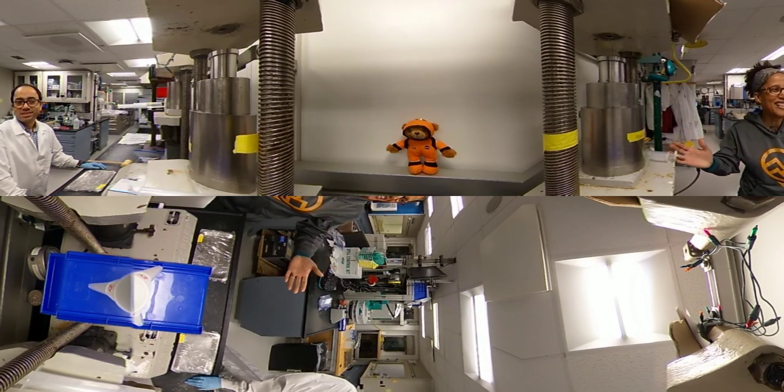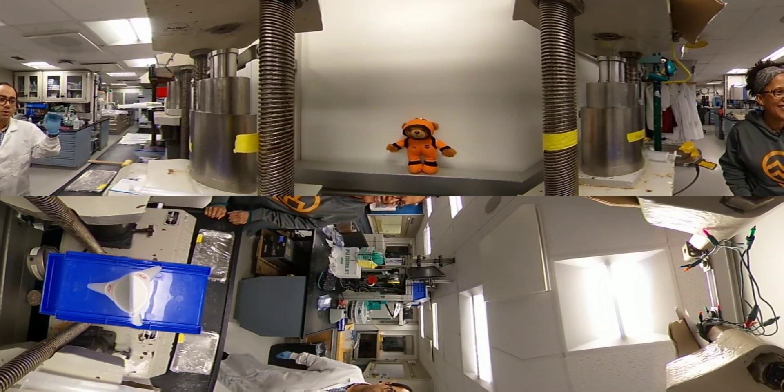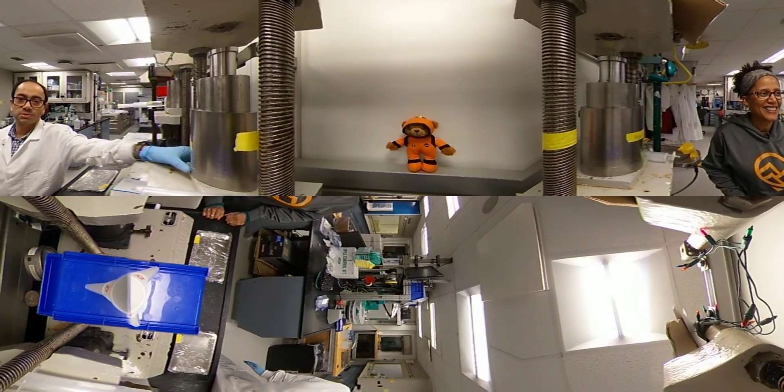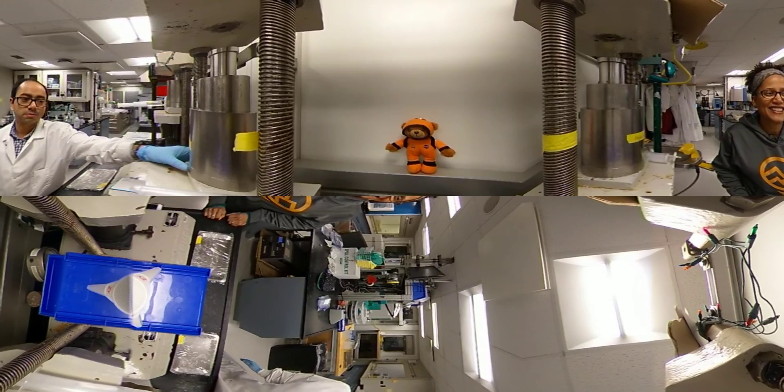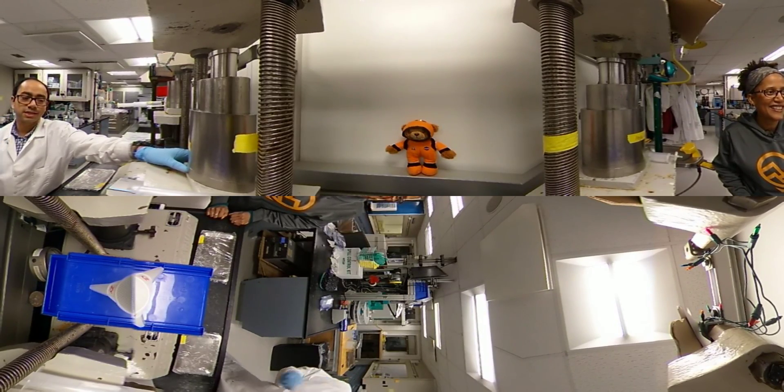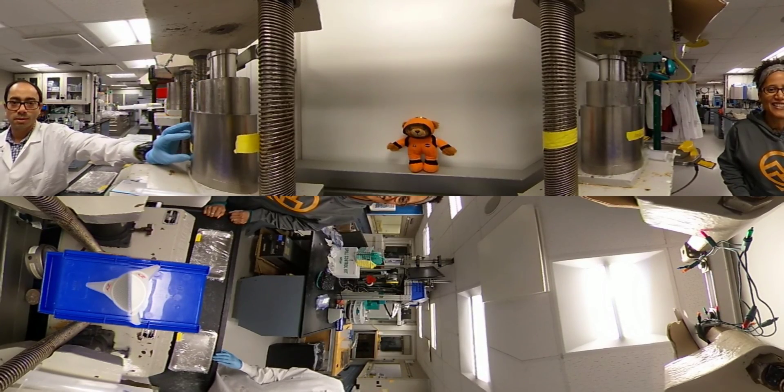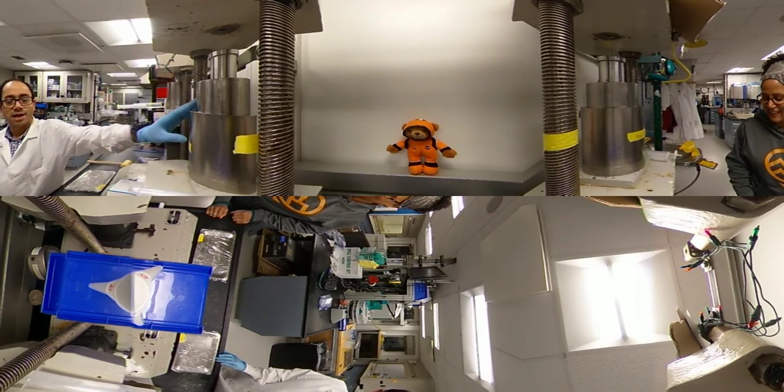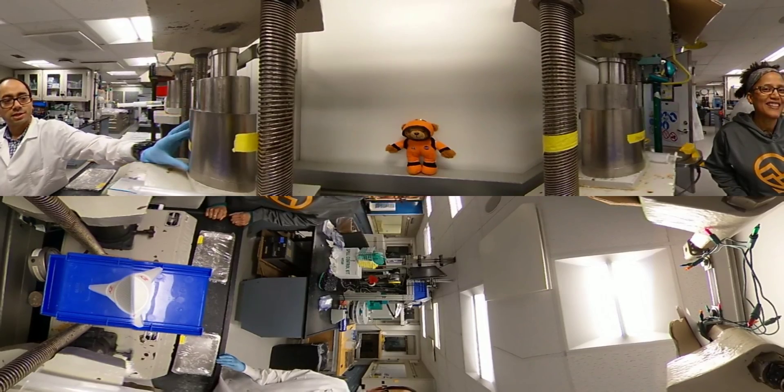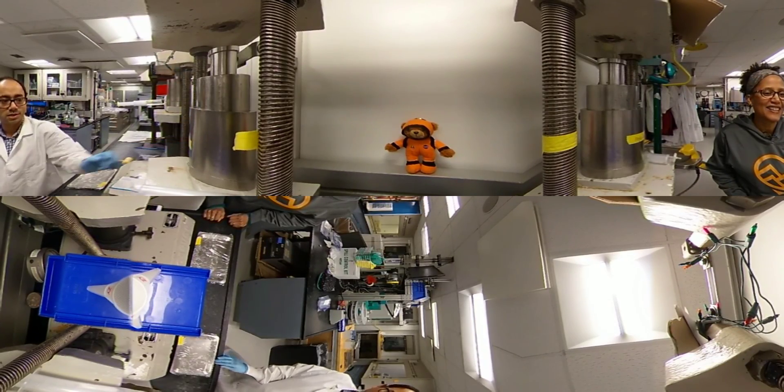Chandranath, what are we doing here? Hello, so here we are squeezing some sediments. The sediments have water in between really tiny spaces. What we've done is put some sediments in this container and now we're going to push and squeeze the sediment, and the water will start coming out.